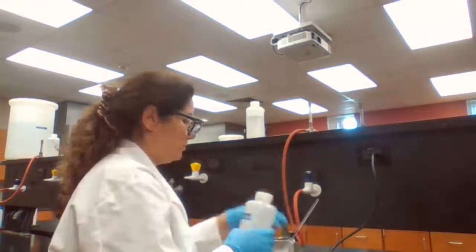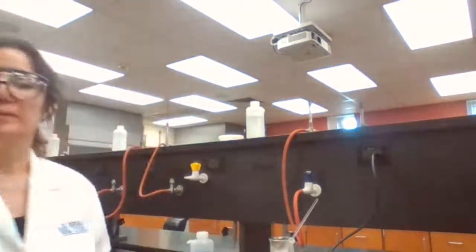I'm going to leave it there for 2 minutes to dissolve completely.